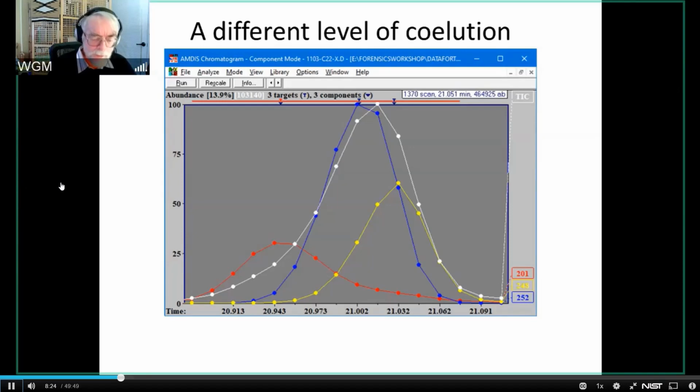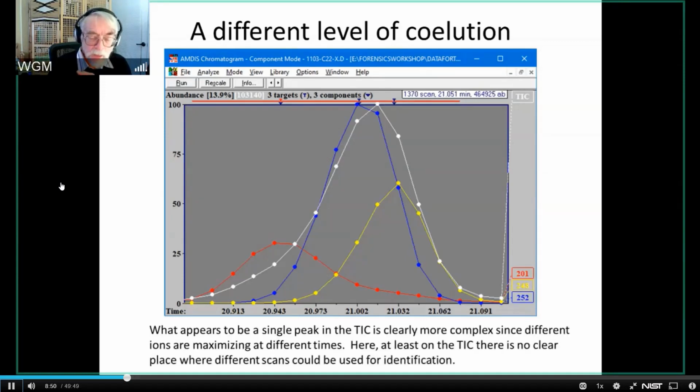So this is much more close to what I would call a true coelution. That's to say that there is no point at which the TIC, this white line, ever dips down during this entire profile. And so there are 3 components here, and AMDIS has successfully identified each one of the 3 components. So what appeared to be a single peak is actually 3 different things. And there is, as I said before, no place in this where if you just take a single scan and search it with the library, you would get really clear, unambiguous data.